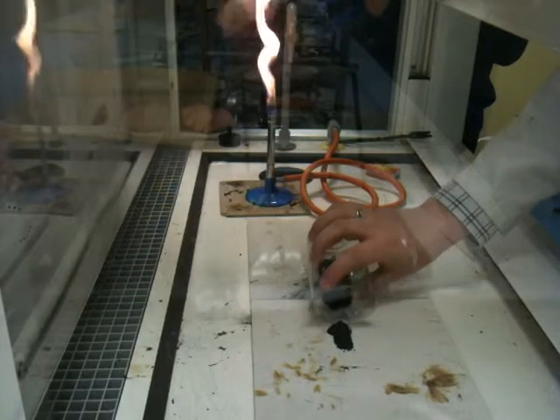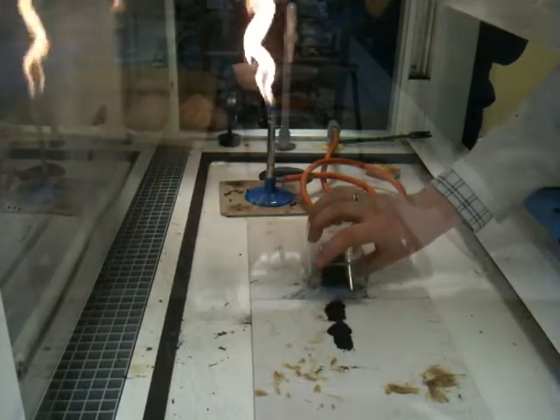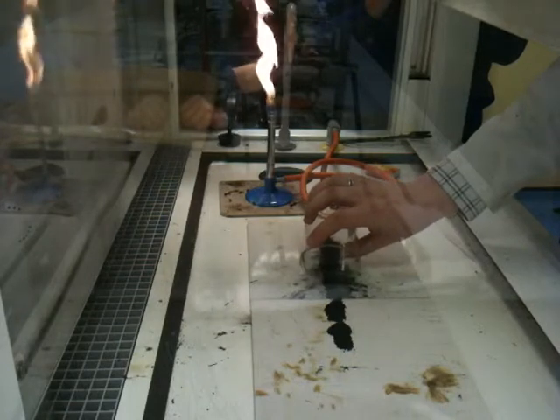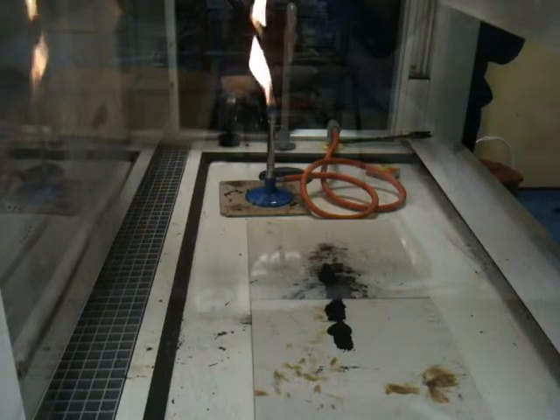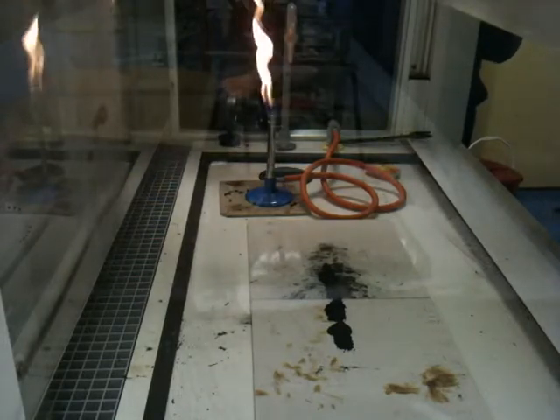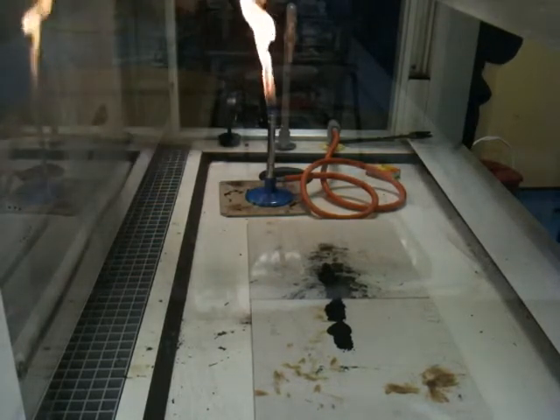So I'm going to lay it down here like this. Don't burn your head again, sir. I'm going to try not to set myself on fire. That's good. OK, and what I'm going to do to get the reaction going is heat it up with a Bunsen burner, OK?